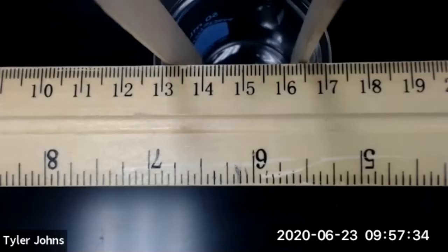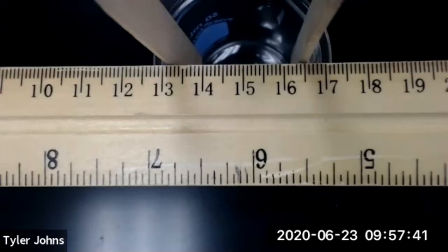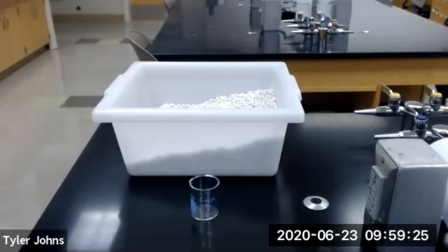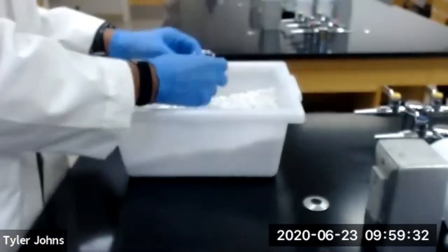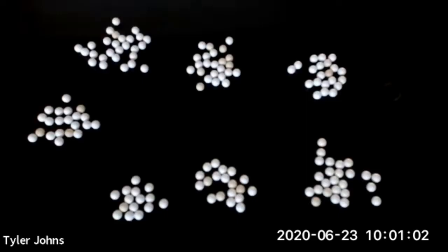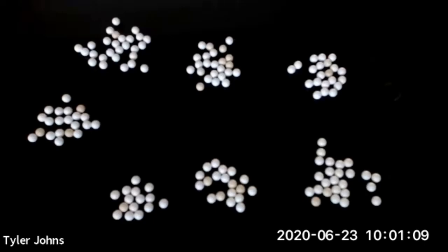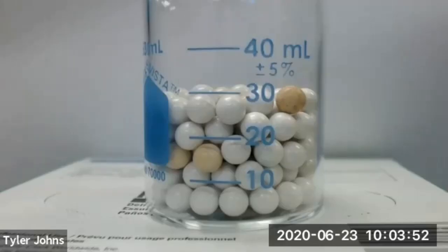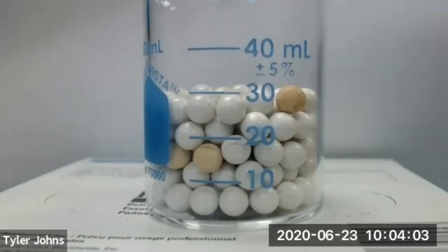The next cylinder we will be using for the BBs is a 50 milliliter beaker. This is the inner diameter of our 50 milliliter beaker or cylinder B. We next need to fill our 50 milliliter beaker or cylinder B at least halfway full with BBs. This is the number of BBs in our 50 milliliter beaker, and this is the total volume occupied by the BBs in cylinder B. You can now calculate the diameter ratio and the packing efficiency for our 50 milliliter beaker.